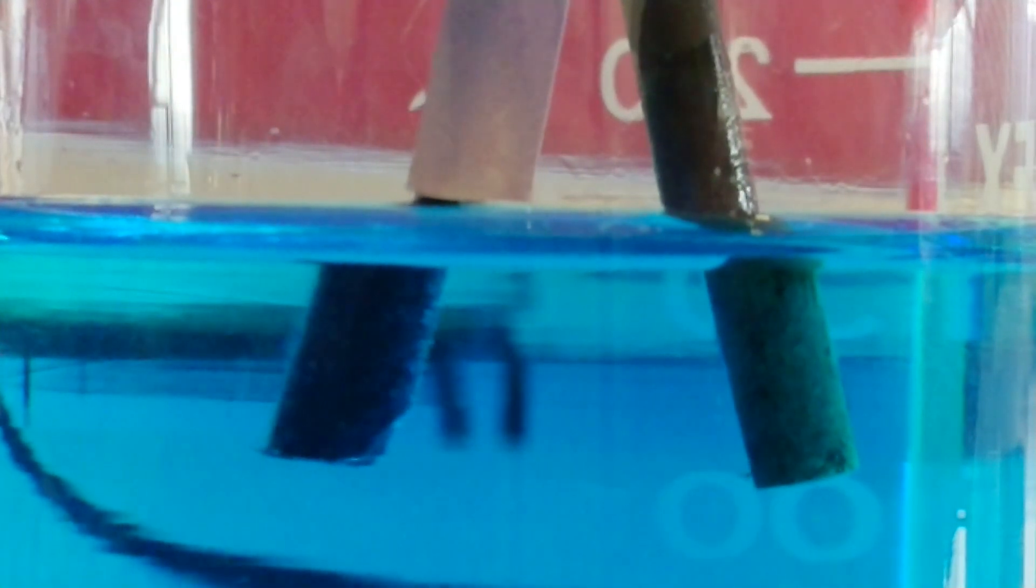If you look carefully, you can actually see that it's starting to change color. It's bleaching slightly. So we can see lots of gas being given off, and actually this is a great image for refraction as well, showing what happens when light enters different densities of materials.